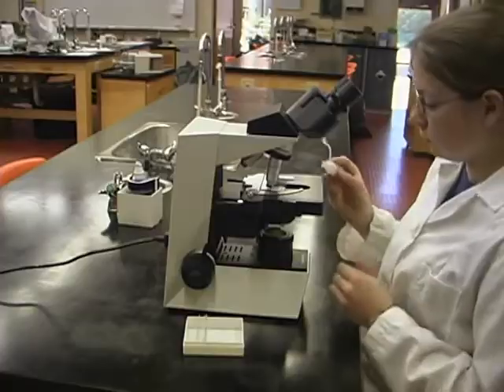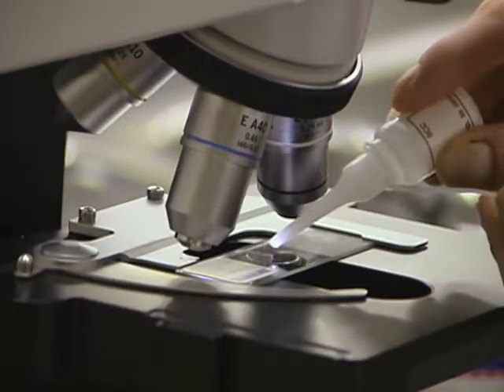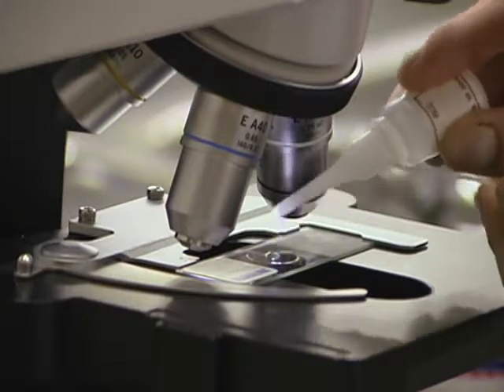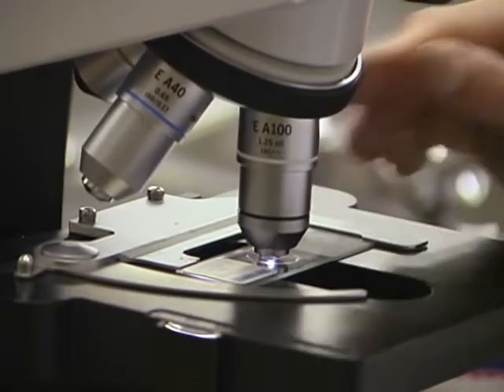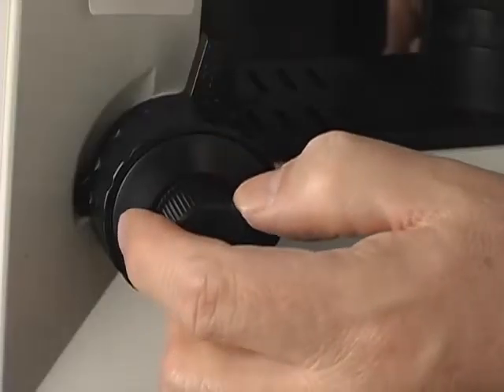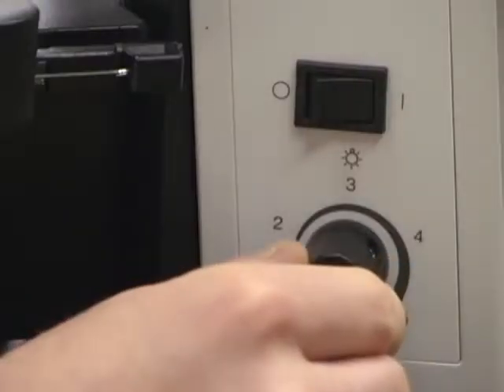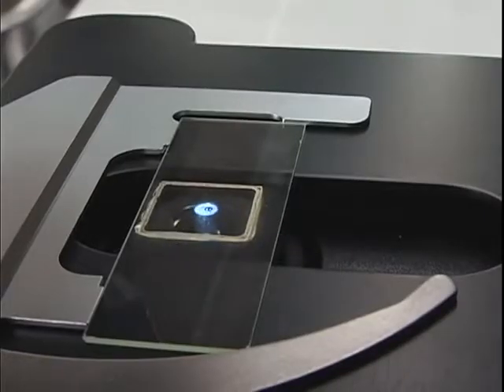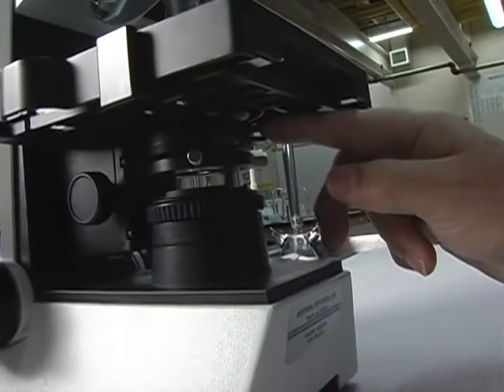Before you rotate an oil immersion lens over a prepared slide, put a small drop of immersion oil on the slide where the light is coming through. Remove any air bubbles with a toothpick. Then, rotate the lens into the oil. Use only the fine focus adjustment to get a clear image. To obtain the clearest image, you may have to increase the intensity of the light source, move the condenser up, and open the condenser's iris diaphragm slightly.